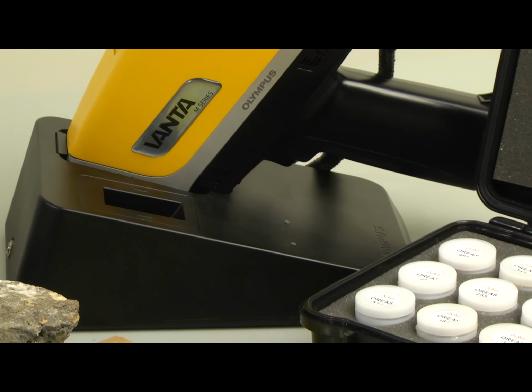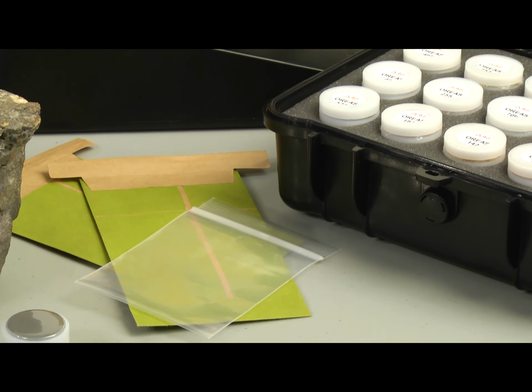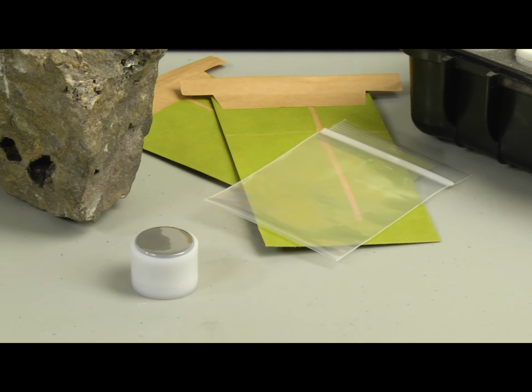When we build our XRFs here in Boston, we test and calibrate them under optimum conditions. Optimum conditions means as a fine powder, usually less than 150 or 250 microns, in a sample cup with a thin Prolene film. That's standard practice. To achieve the best results possible, our samples are homogeneous and we put them under conditions to ensure minimal distance between the material and the detector.